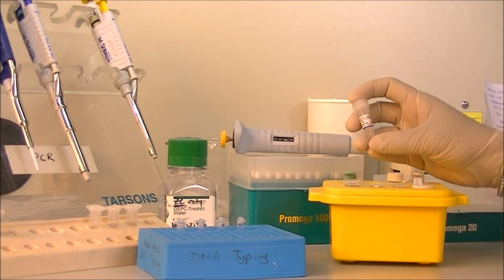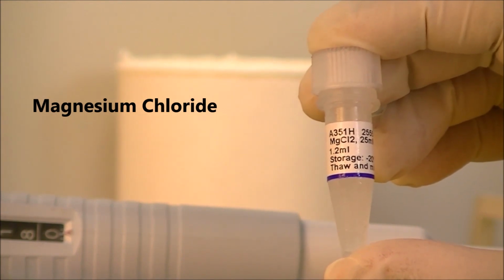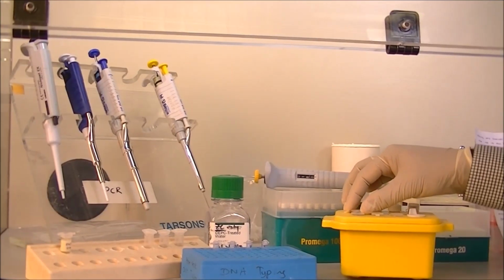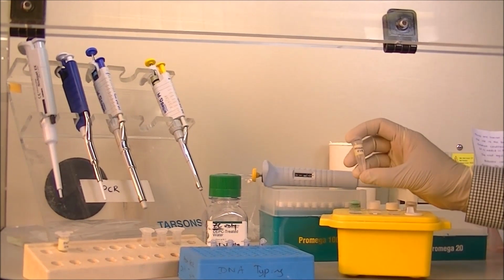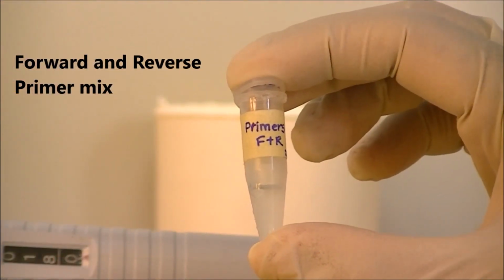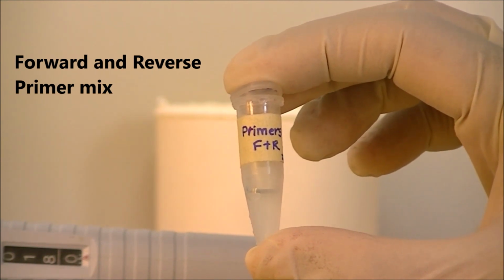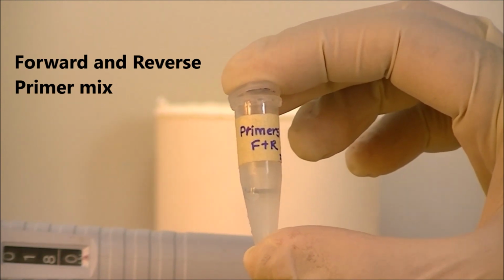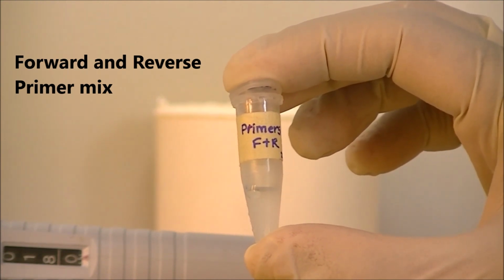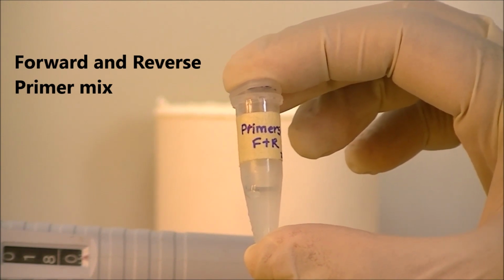The next chemical that we are adding is magnesium chloride. Magnesium chloride helps to anneal the PCR enzyme to the DNA strands. Next into the reaction is the primer mix. This primer mix contains equimolar concentrations of forward and reverse primers. A primer is a piece of DNA which corresponds to the pieces of DNA that you are trying to amplify during the reaction.